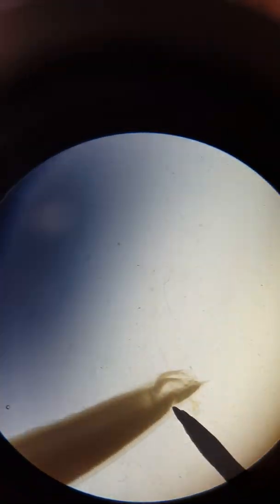It's hard to hold this. You can still see it though, and the myomeres are quite distinctive on this one. Maybe I'll try cutting one open and see what I can see.